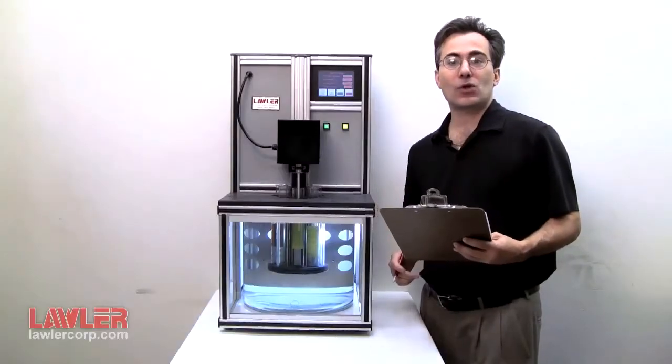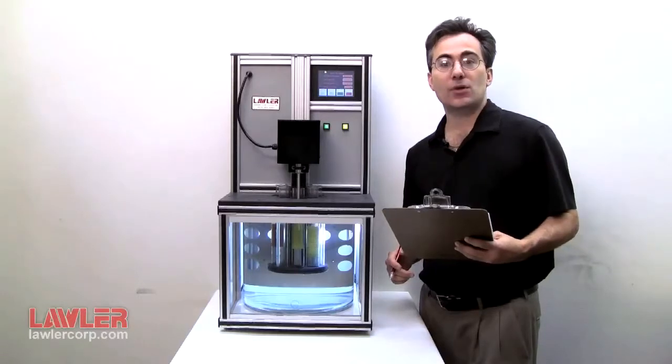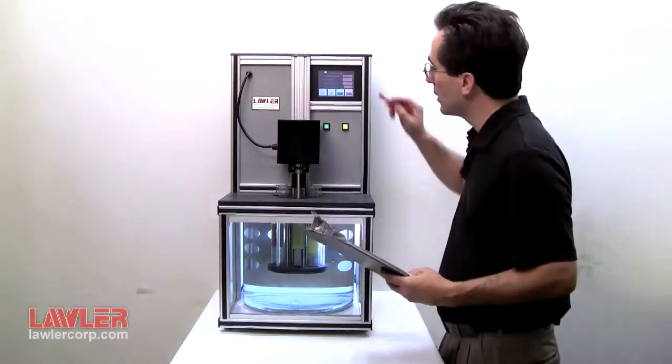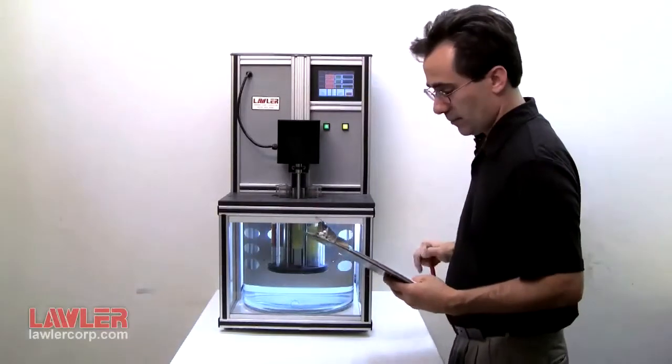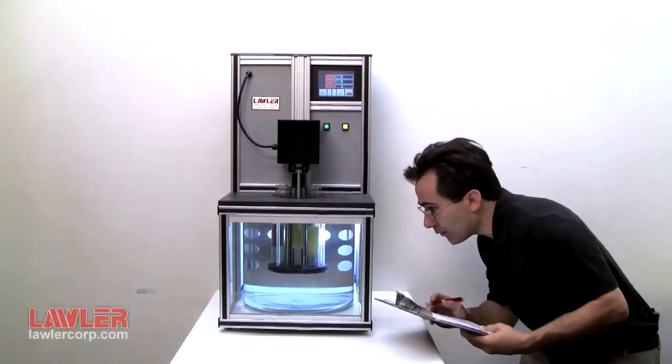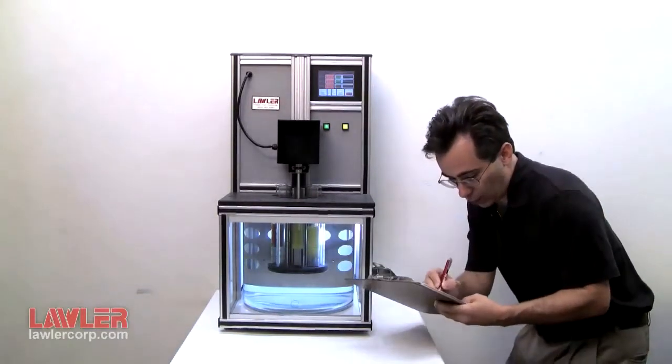At 5-minute intervals after starting the timer, it will indicate that an observation is required. Acknowledge and make note of the graduated amounts of oil and water separation.